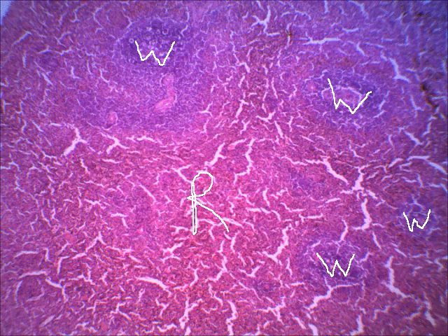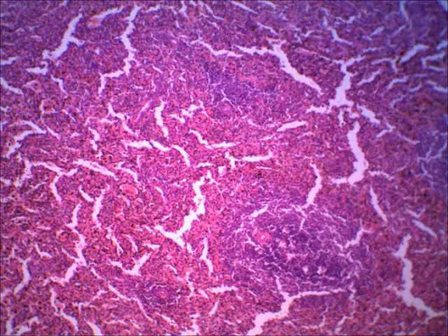Okay, now that's on the scanning. If we go a little bit higher in the magnification, this would actually be a low power. You know, low is a little bit higher than scanning. But here you can easily see that would be the white pulp. And then everything else you see in here is red pulp. And you can see the sinuses that the blood's going to drain through. Okay, I believe that's it.